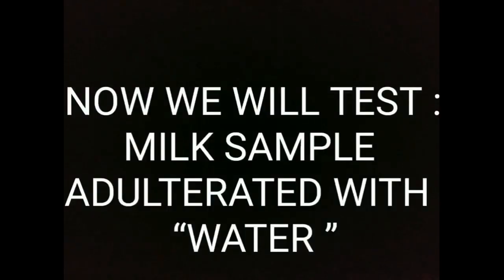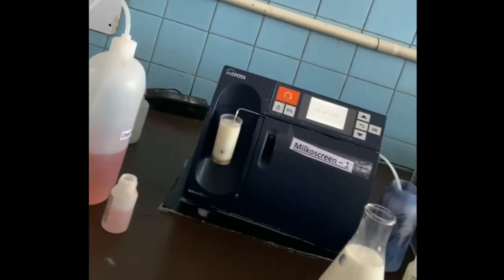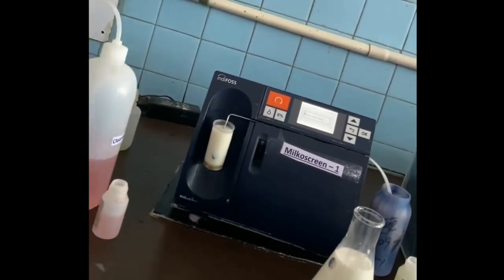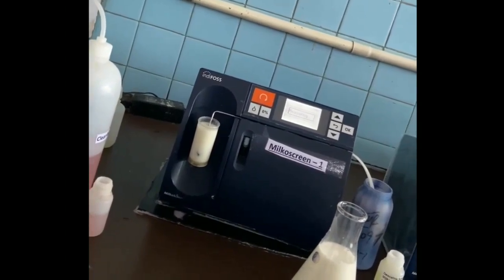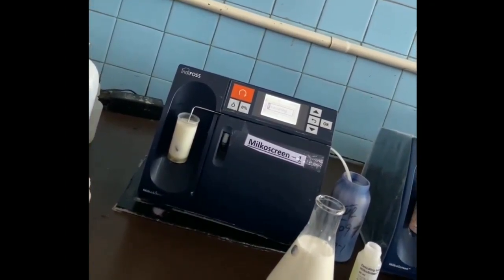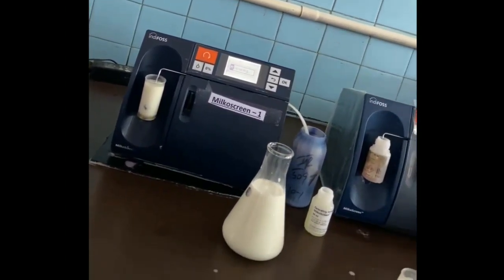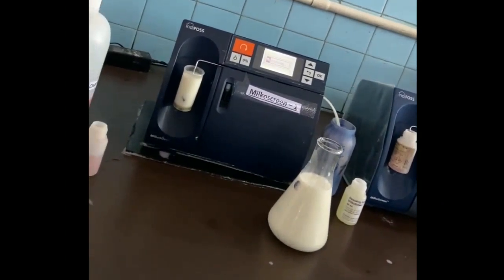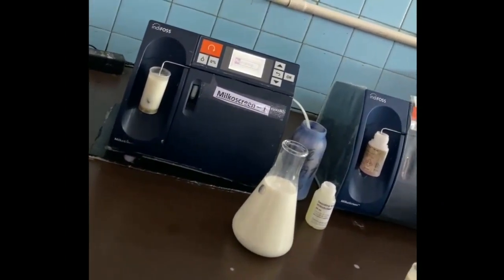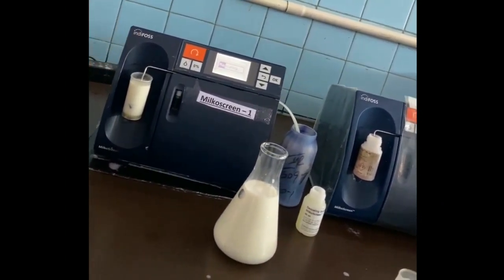Now we will test the milk sample which has water as an adulterant. This is the milk sample and the machine has started to measure. Again it will take a little time.